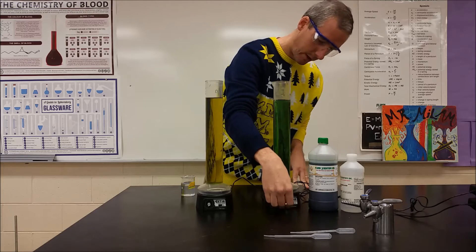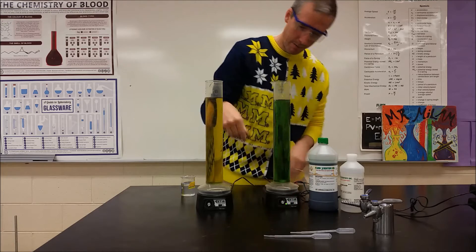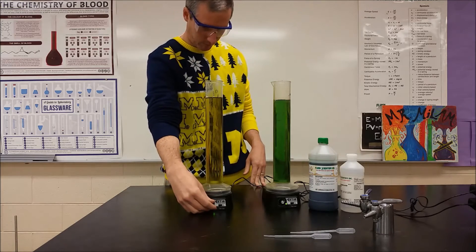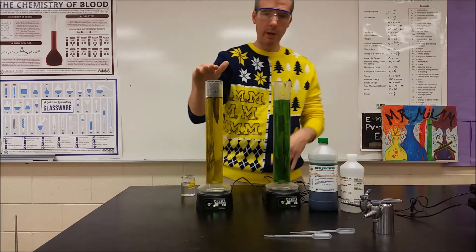We're going to go ahead and get that uniformly mixed and same thing over here. So we're distilled water here or tap water here.